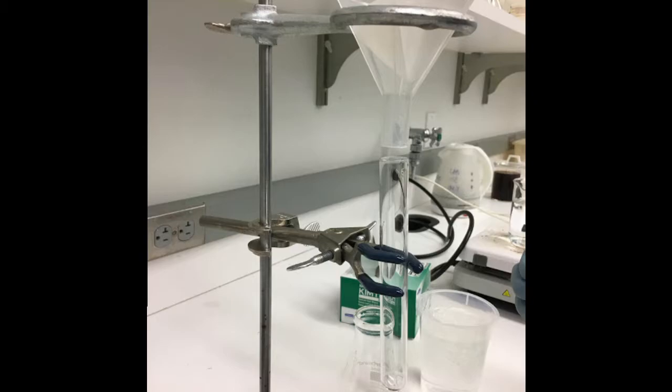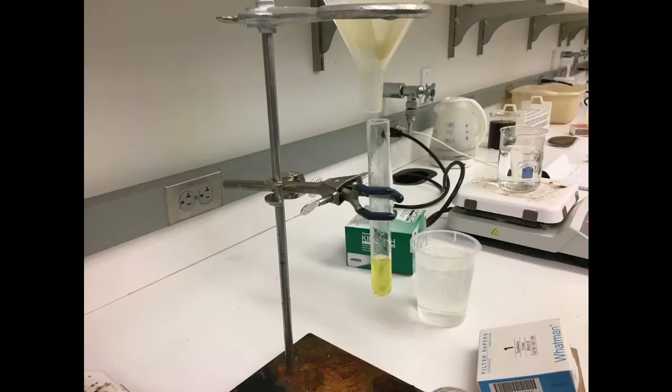Place a piece of filter paper in the funnel and use a test tube holder or wear a cotton glove to pick up the test tube out of the hot bath and slowly pour the hot contents into the funnel.